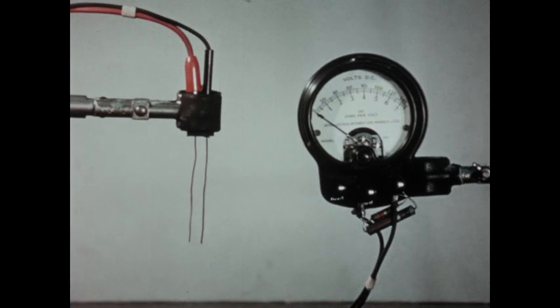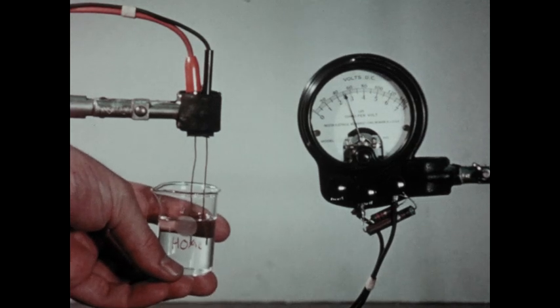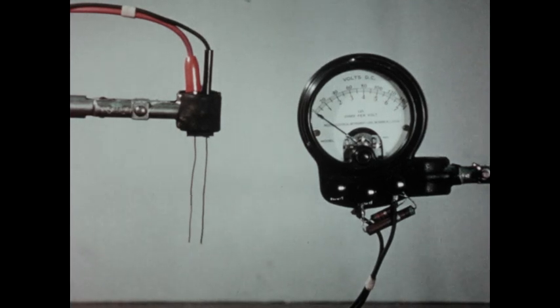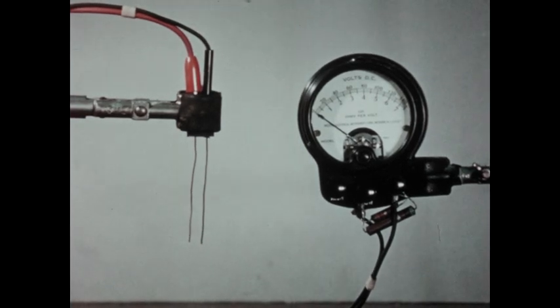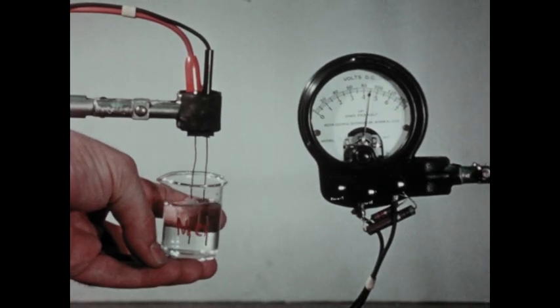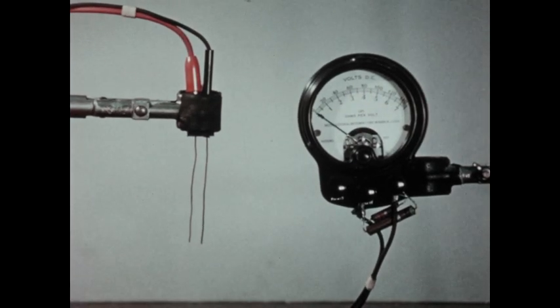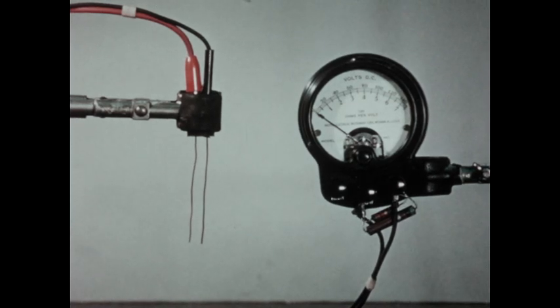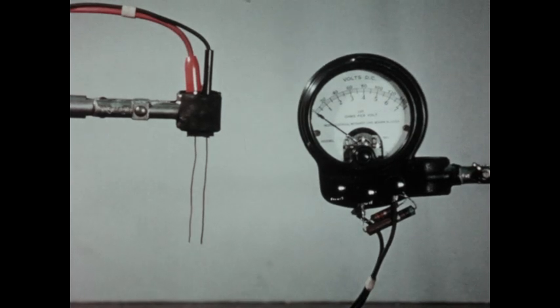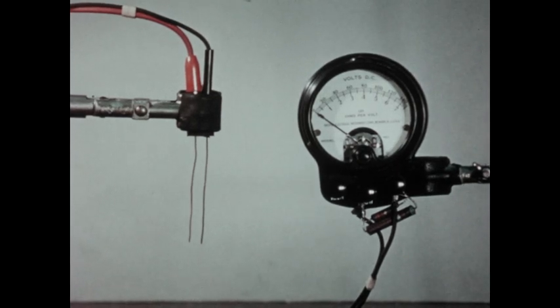Next, we'll test a dilute solution of acetic acid, and we get a reading on our scale of between two and a half and three units. And finally, we'll test the conductivity of a sodium chloride solution, similar to the one we used in the boiling point experiment. This time we obtain a reading of about four and a half units. From this experiment, we see that the solute with the highest conductivity—sodium chloride—is also the solute which produced the most abnormal effect on the boiling point.